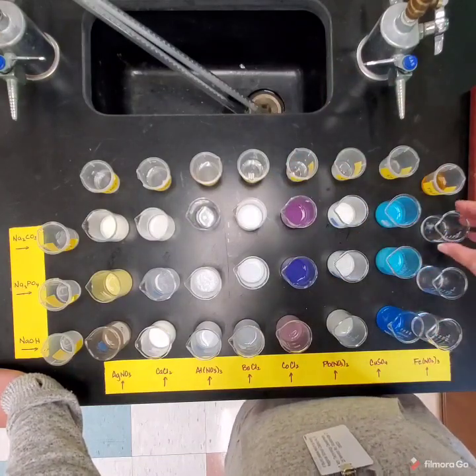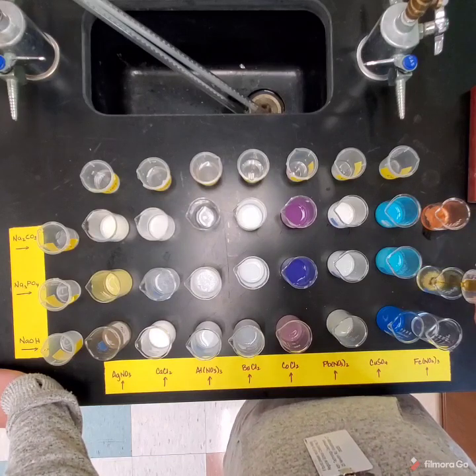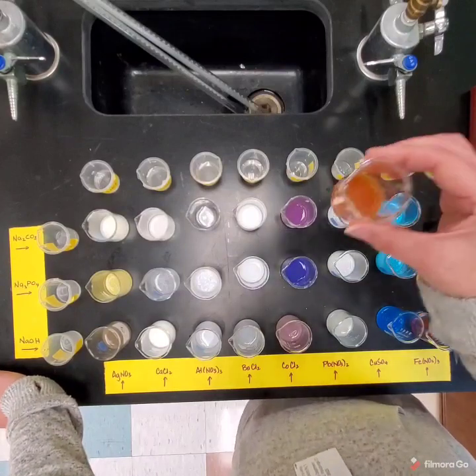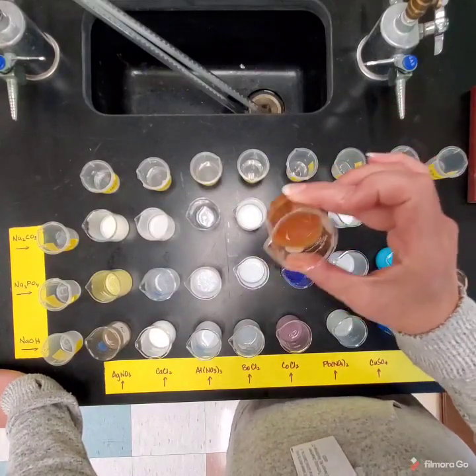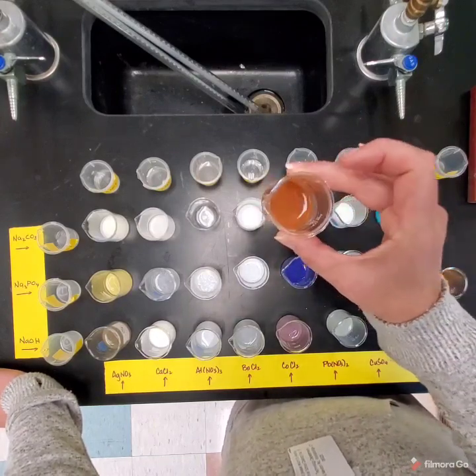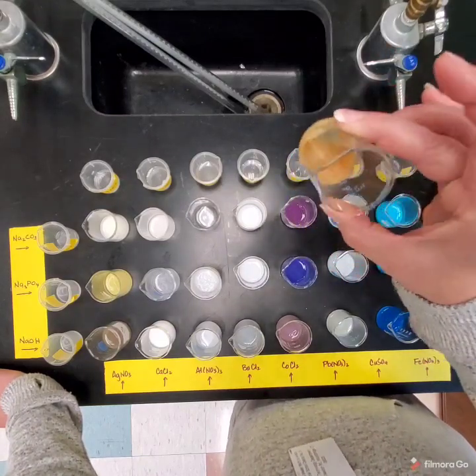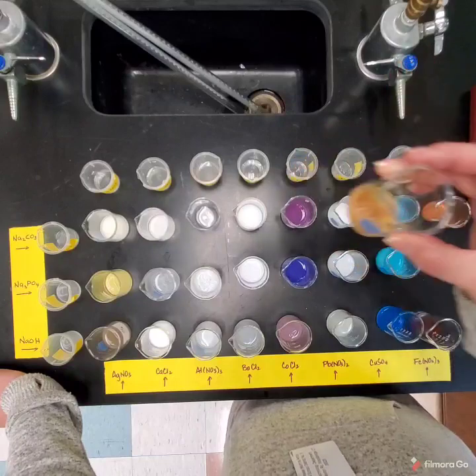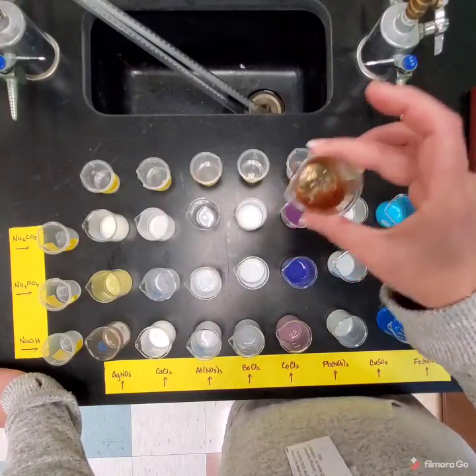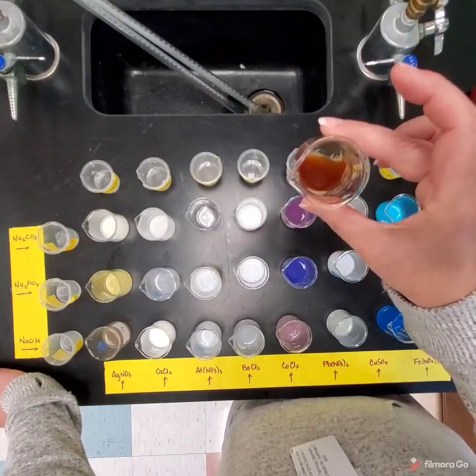And then the last one is iron. So here's your iron nitrate. That one, I'm hearing bubbles, so there is some gas being given off as well. That one definitely is gel-like. It's got this sort of thick consistency. And that one's kind of more dissolved. But we have this darker brown.